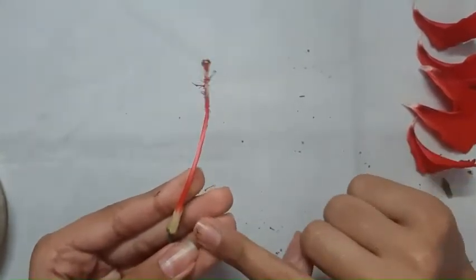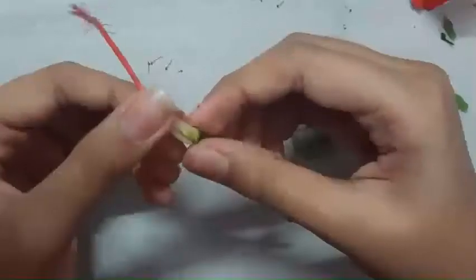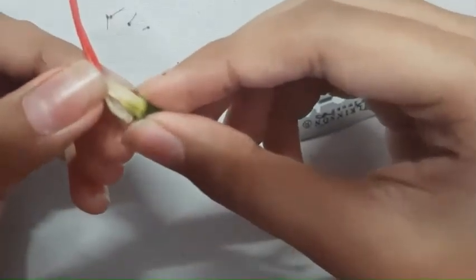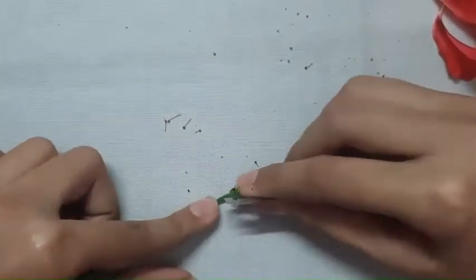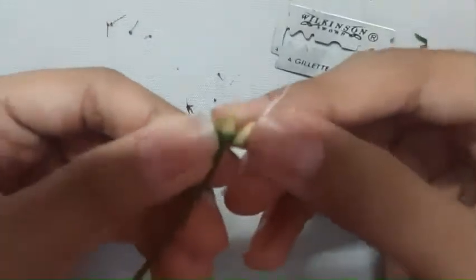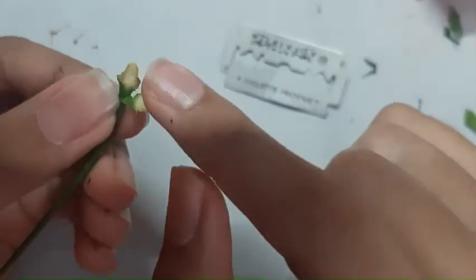Now I will cut the ovary and show you the ovules.